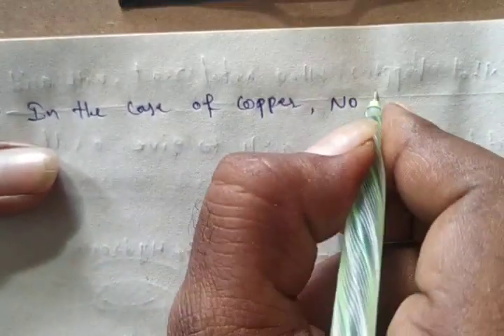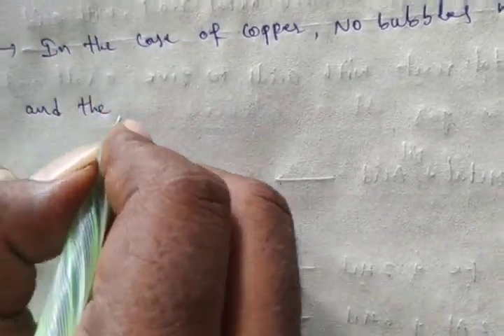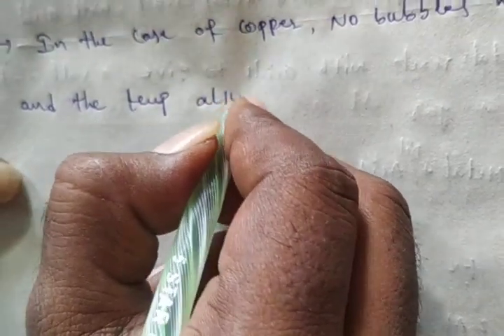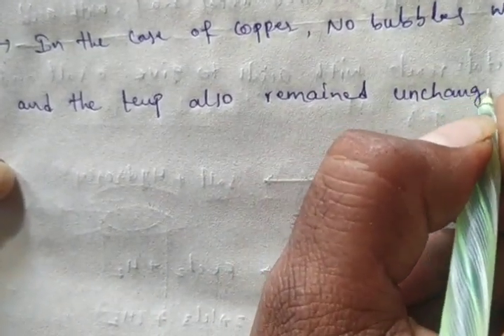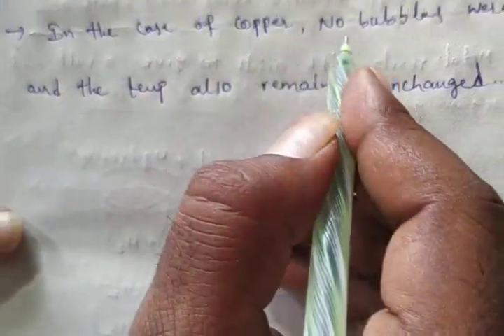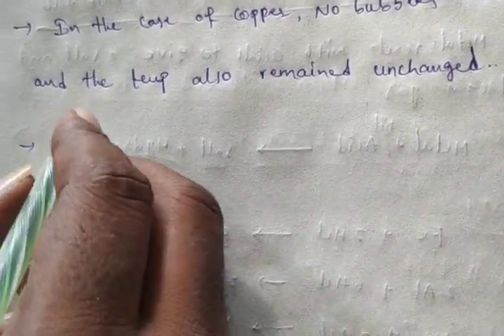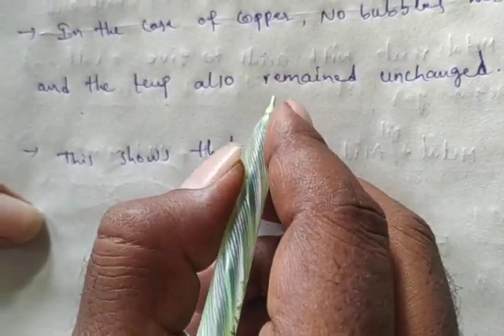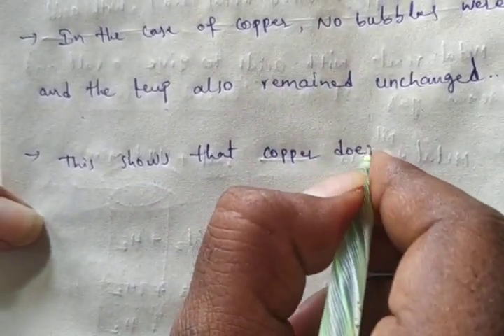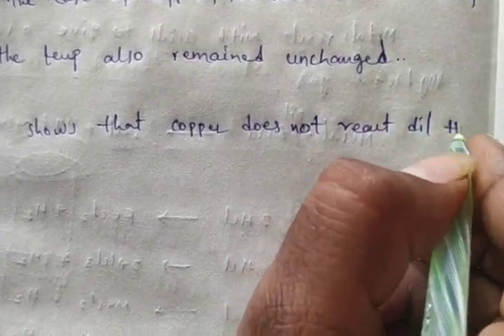No bubbles were seen and the temperature also remained unchanged. In the case of copper, no bubbles were seen and the temperature also remained unchanged. From this, we have to identify — this shows that copper does not react with dilute HCl.